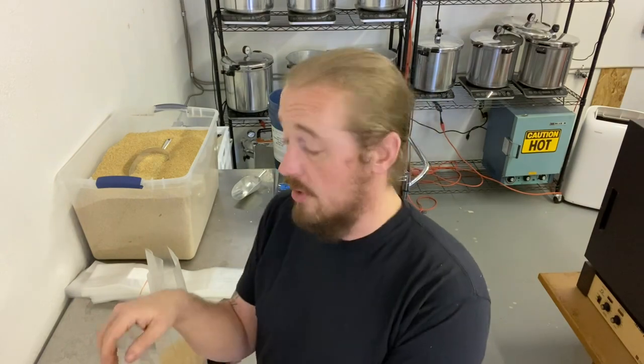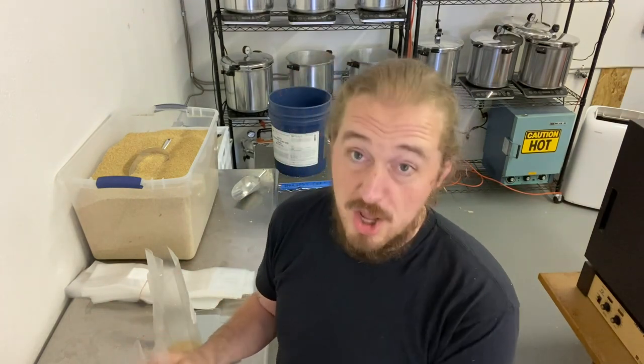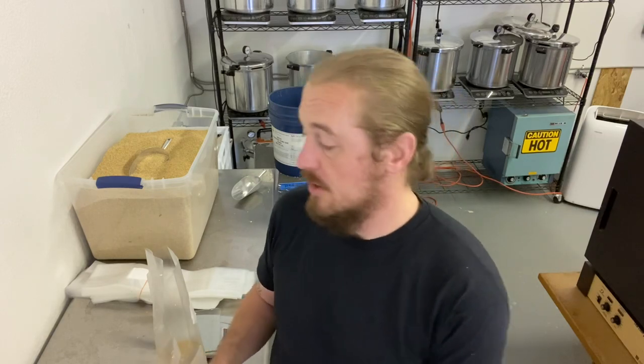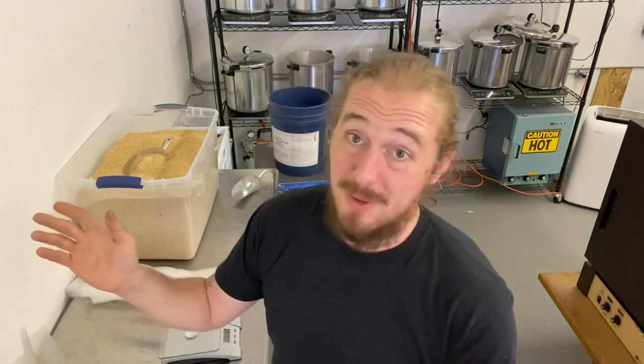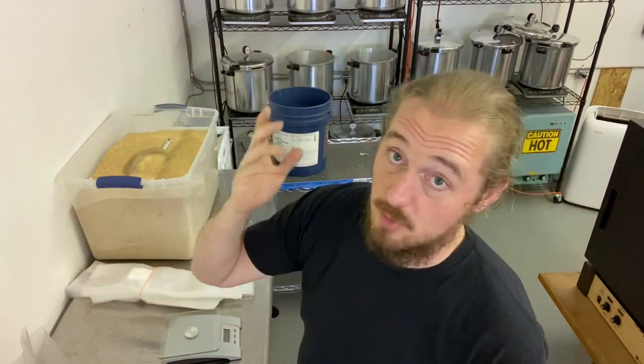Now, if it's really late, or you're tired and want to stop halfway through and pick it up in the morning, you can just turn them off. Just remember to refill the water - otherwise you'll melt the bags and they'll burst and pop and everyone will be sad.